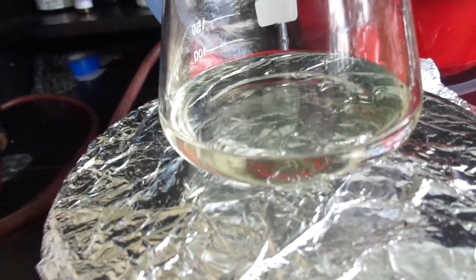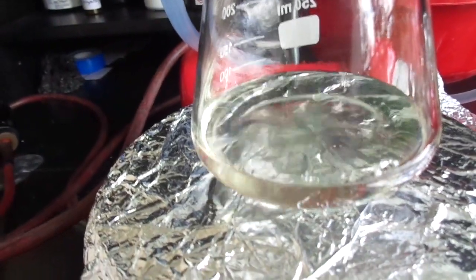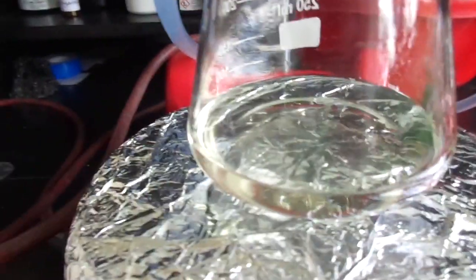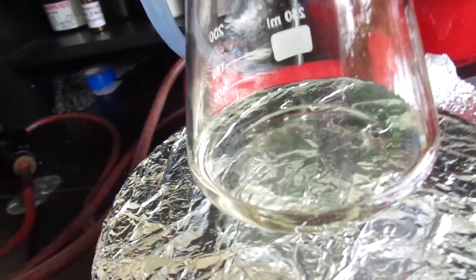So I filtered the insoluble stuff and as you can see I'm again refluxing it and then I will distill the ethanol and separate the triethyl citrate. The insoluble stuff was calcium sulfate and you might ask where did it come from?